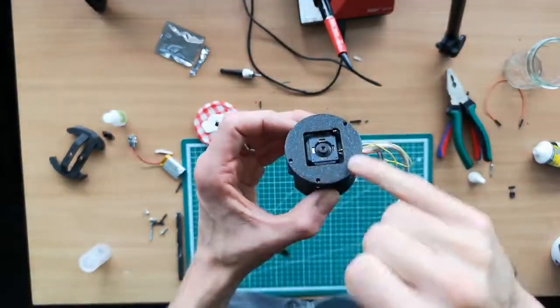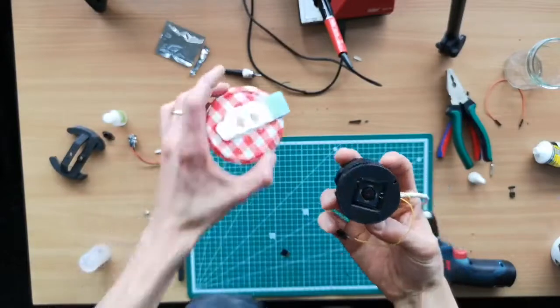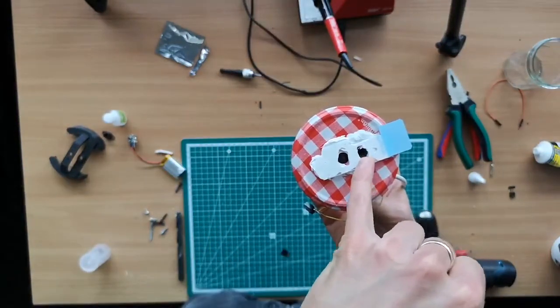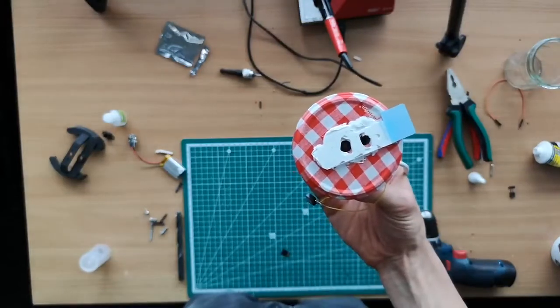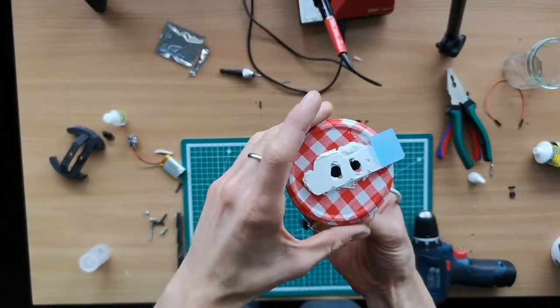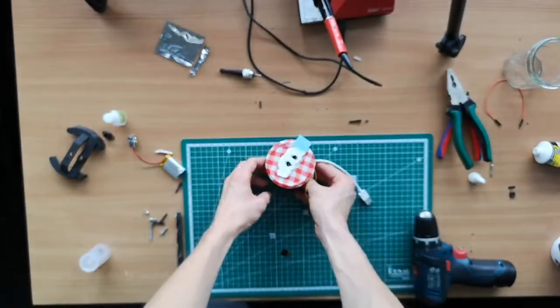And so the next bit would be this here mounts here. We add some glue and make sure that the hole for the illumination is aligned that way so that the illumination can be transferred here. And then you're pretty much done. And we are going to do that now. But before, we also set up the illumination.